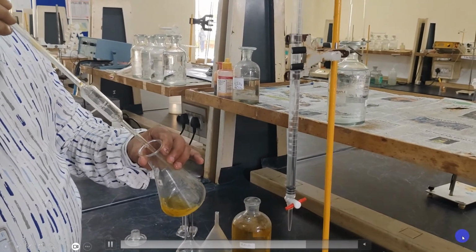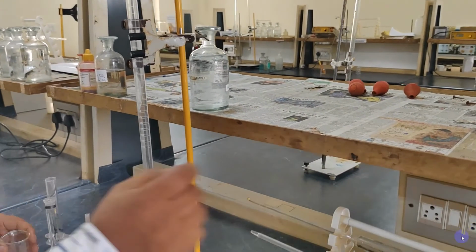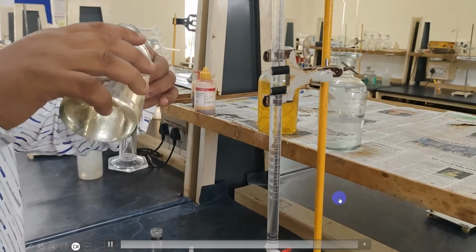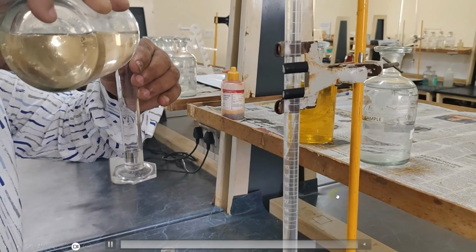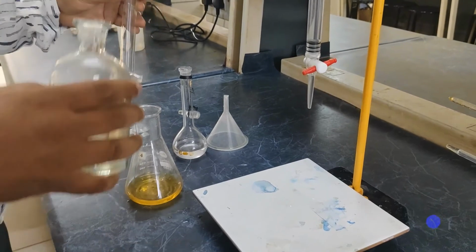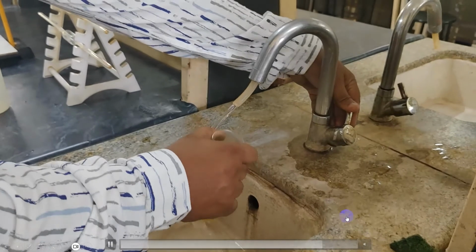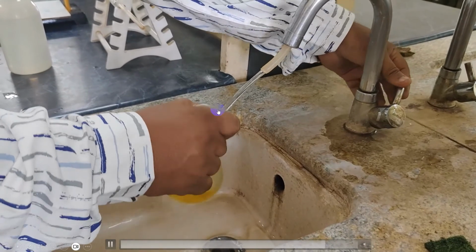We have to add the sulfuric acid mixed with silver sulfate solution, and we have to keep the solution for boiling for half an hour. Add silver sulfate with the sulfuric acid around 10 to 15 cm cube. After adding, keep the mixture for boiling for around half an hour. So we have to follow all the same steps which we had performed in the previous one. Once the solution has been boiled, cool it under the tap water and you can initiate the reaction.